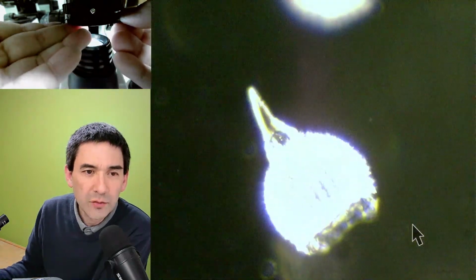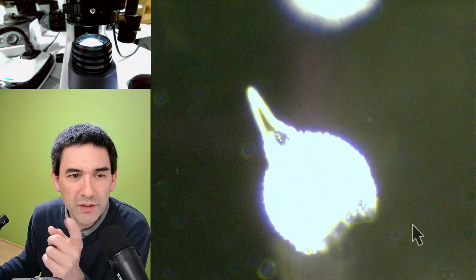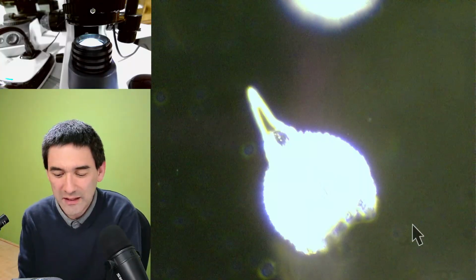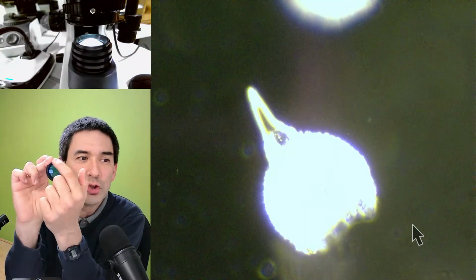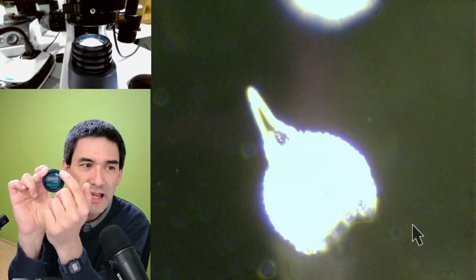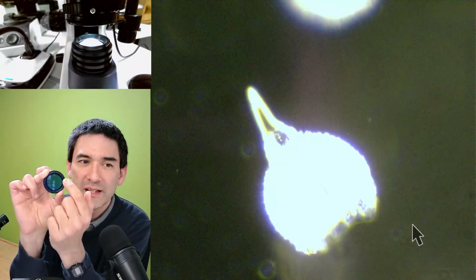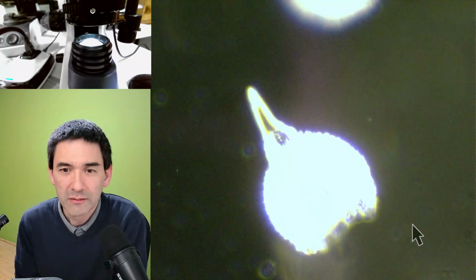Okay, and the reason why the background is now black is because it is actually the edge of the filter that's now blocking out the light. That's the reason why it looks like dark field. It's the edge here that's now in the center of the image, and this causes the specimen to look bright on a dark background.